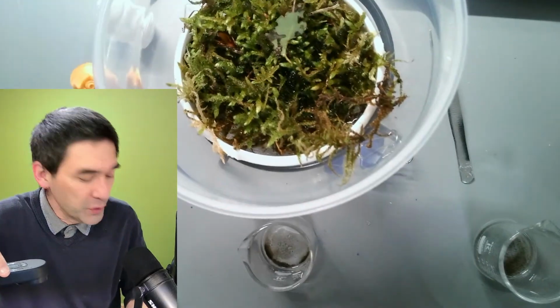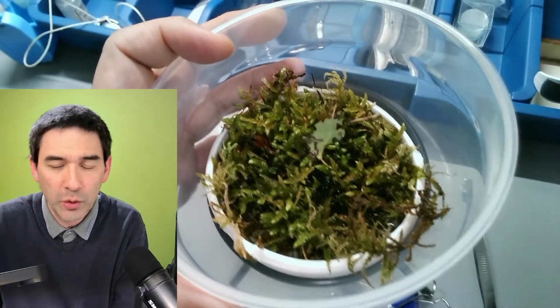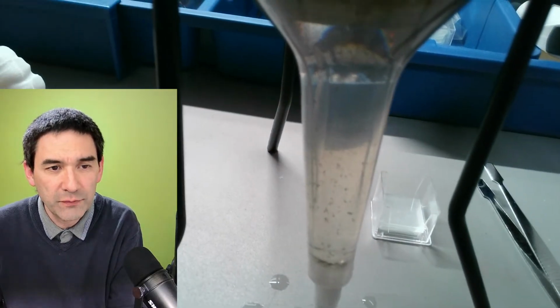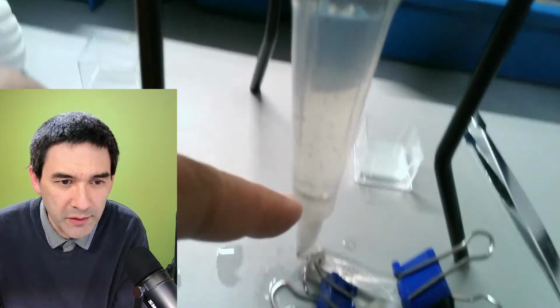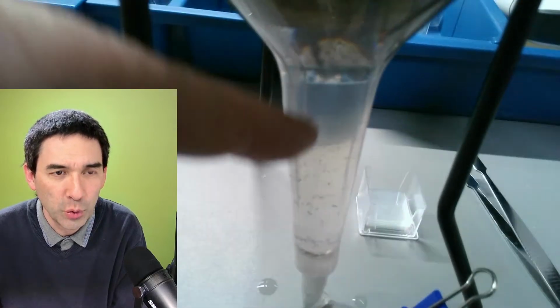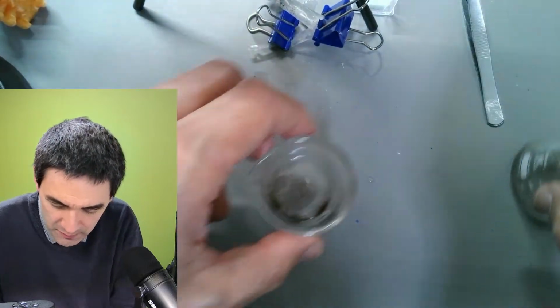Okay. So for those of you who just joined, very briefly, a little summary of what I've been talking about. This is a so-called Baermann funnel, not bear like the water bear, but named according to Mr. Baermann. There is a sieve in here. I put some moss in here, and all of those particles that are falling down here you can put under the microscope, and a lot of nematode worms, rotifers, water bears, whatever, will collect down here. And this system down here definitely needs improvement. Maybe a shorter funnel, but this one is not ideal. Obviously. So I'm going to show you now how I've been experimenting around.